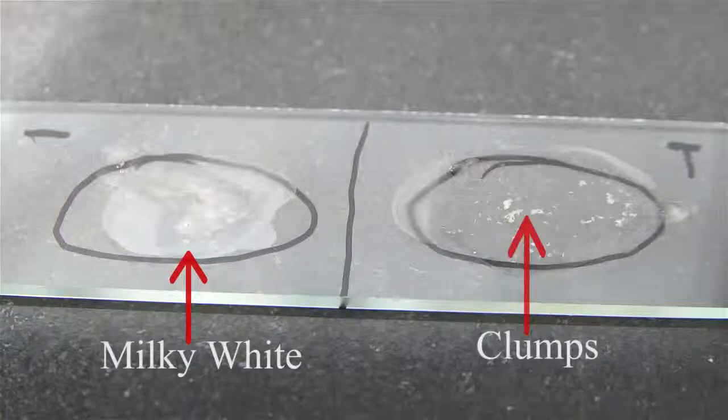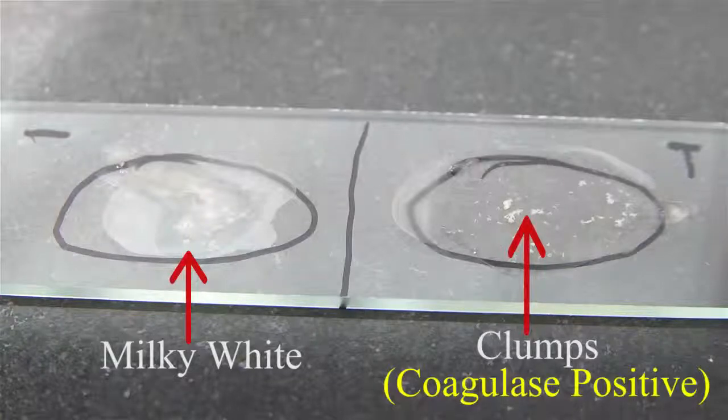As the test sample also forms clumps like the positive control, it can be reported as coagulase positive Staphylococcus or Staphylococcus aureus. All strains testing negative for slide coagulase should be tested further by the tube coagulase test.